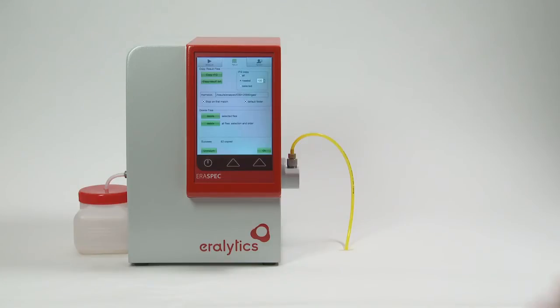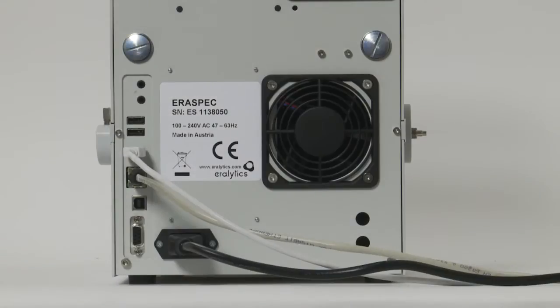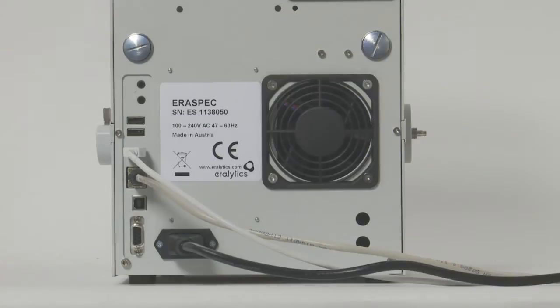A very convenient alternative is the automatic transfer of the data to a LIMS system. There is no software required. Just connect the instrument to the local area network via the built-in ethernet connection and define the folder and file name where the results shall be stored.